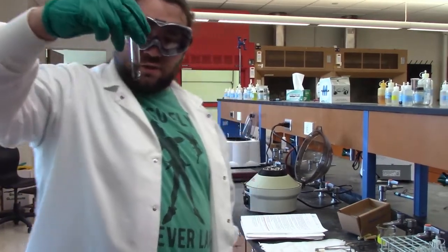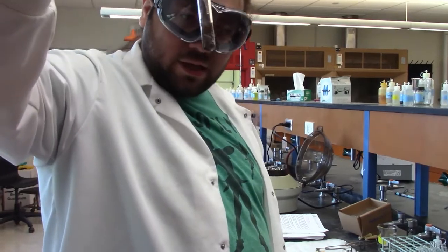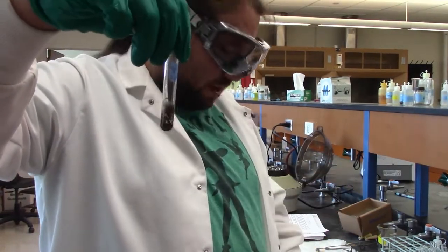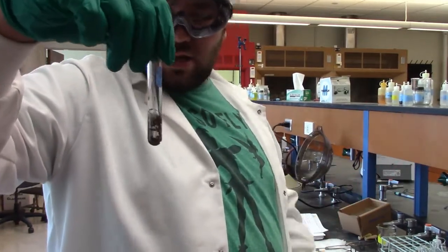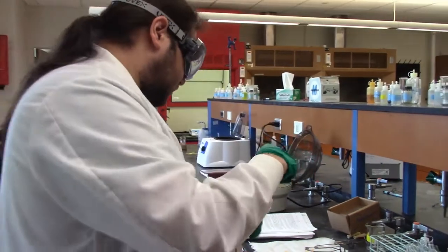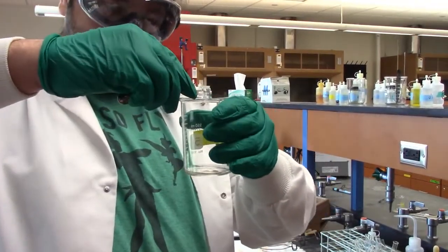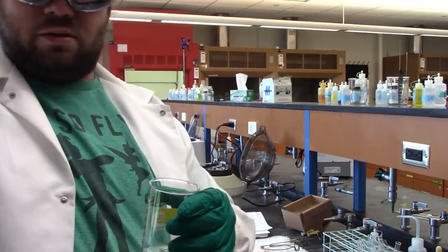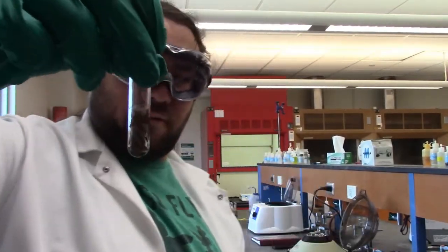Alright, so I've centrifuged it after mixing my ammonium chloride, and the solution's clear again. The ammonium chloride was just to kind of wash out anything that might be bad from the precipitate, so we don't really need anything that's in there, so we're once again going to decant that. So here's my waste beaker. And there you have it. Now I just have my black precipitate again, which has all of our sulfides that we're now going to test for.